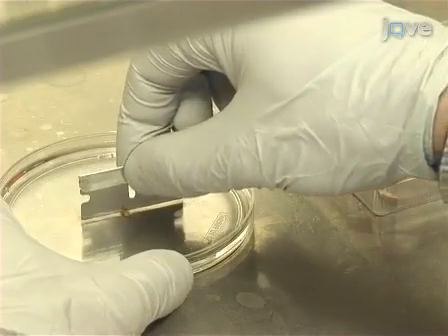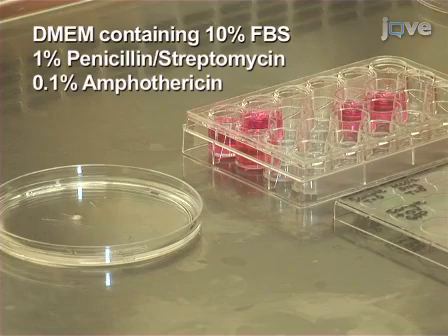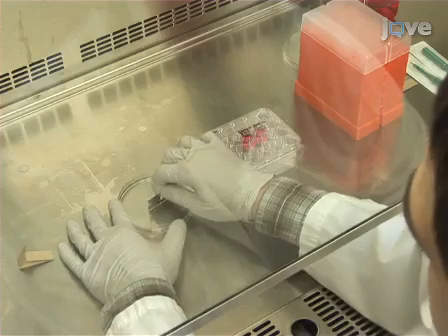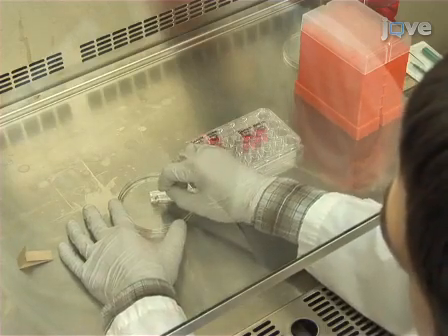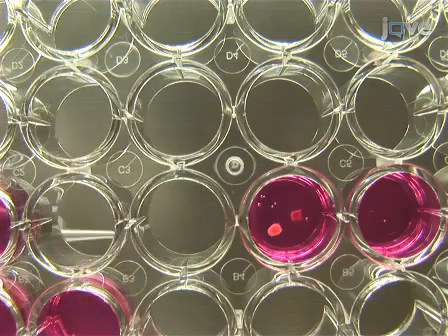Use a sterilized razor blade to split each tissue core into 4 even quarters. Then, use a pipette tip to place each quarter into 4 separate wells of a 24-well plate containing 2 milliliters of media. Repeat, using each quarter of a second core and placing these quarters into the same 4 wells of the 24-well plate. Continue in this manner until all of the tissue cores have been plated.